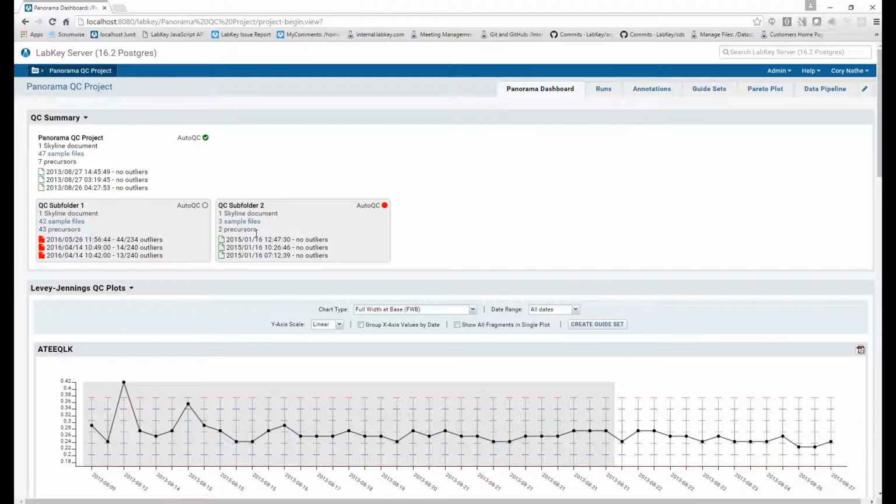The second improvement for the QC summary web part is an indicator of the auto QC status for that container. The targeted MS module uses an auto QC tool to ping the server so that it can check if a given container exists or has been moved, things along those lines. So this auto QC indicator that you'll see in the upper right hand section of each container's information gives the status of the last auto QC ping for that given container.